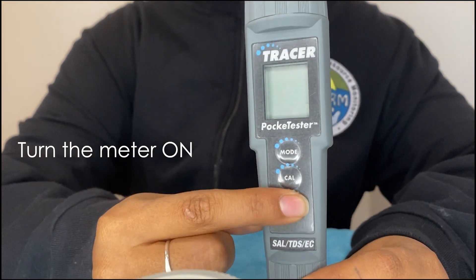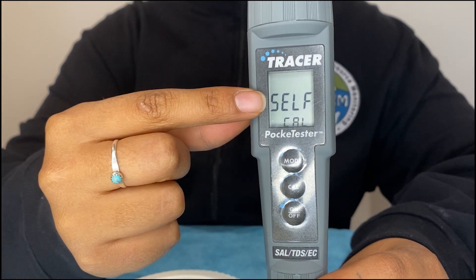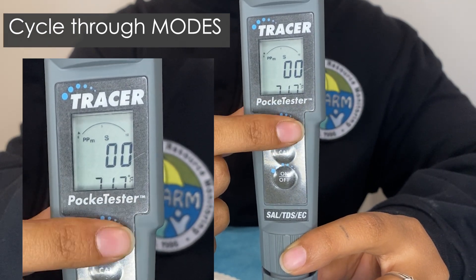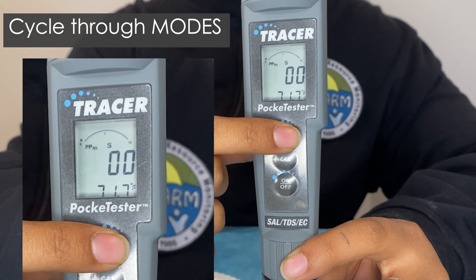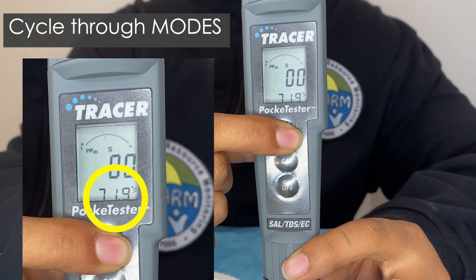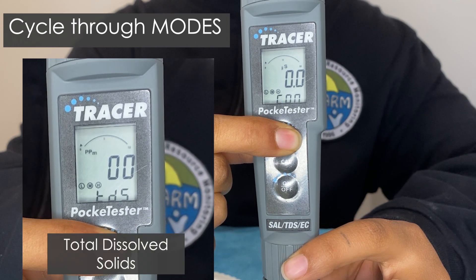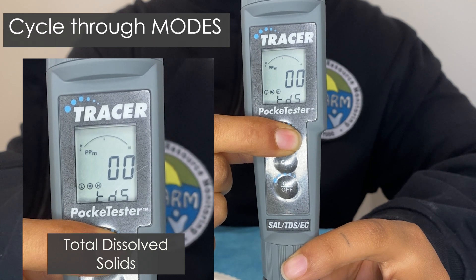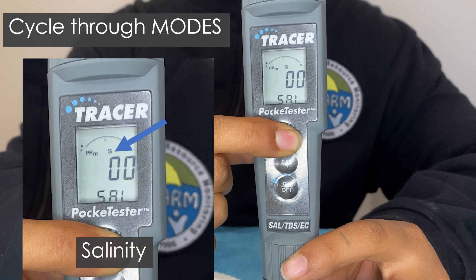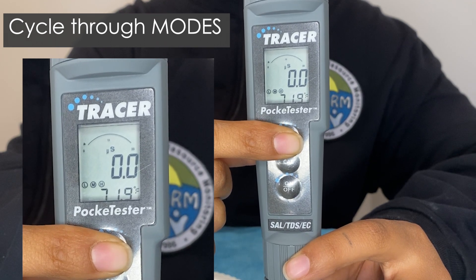To explore the different modes on your meter, turn your meter on. There are three modes on this specific meter and three different units associated with each mode. To cycle through the modes, press and hold the mode button. For CON, or conductivity, this will be shown with the unit microsiemens at the top of the screen. For TDS, or total dissolved solids, the unit PPM will be displayed. And for SAL, or salinity, the unit PPM will be displayed. For the purpose of this video and our monitoring, we will be using the mode CON for conductivity.